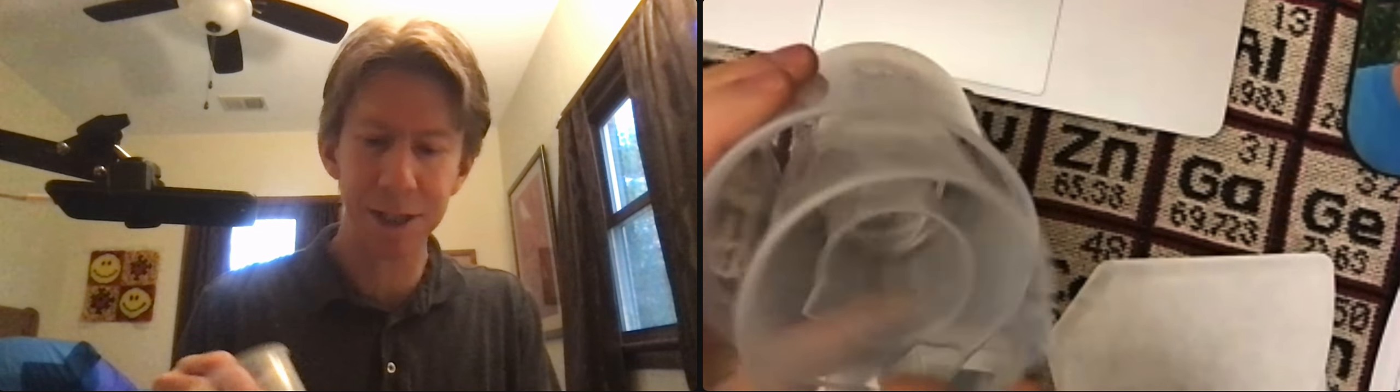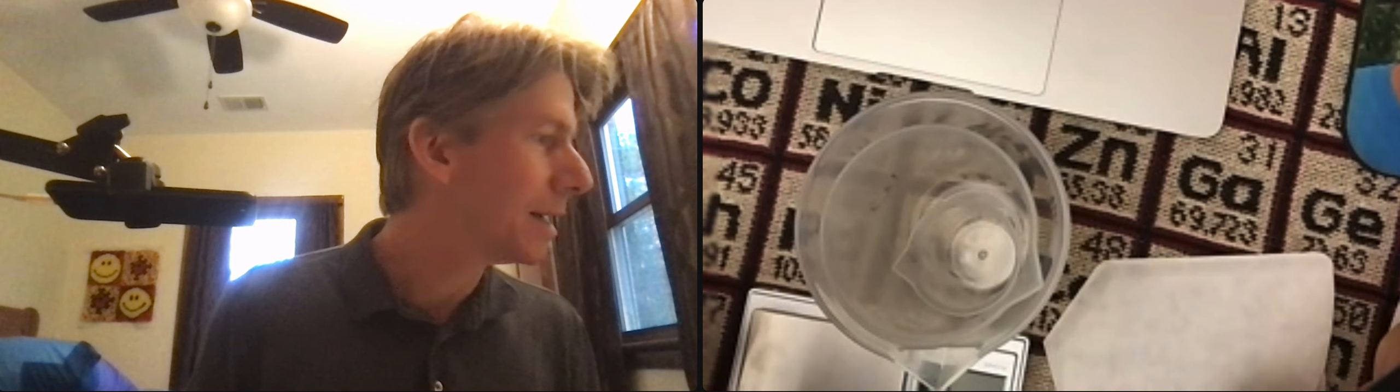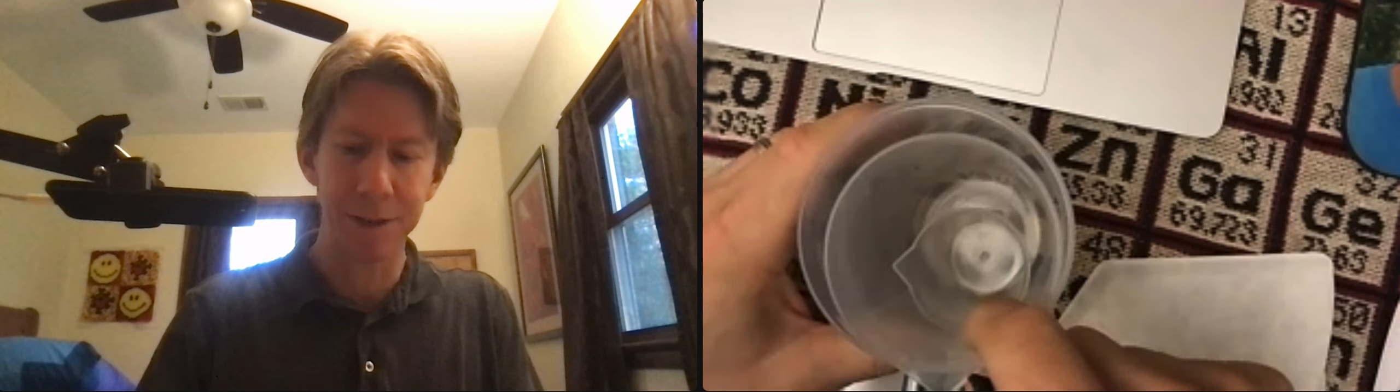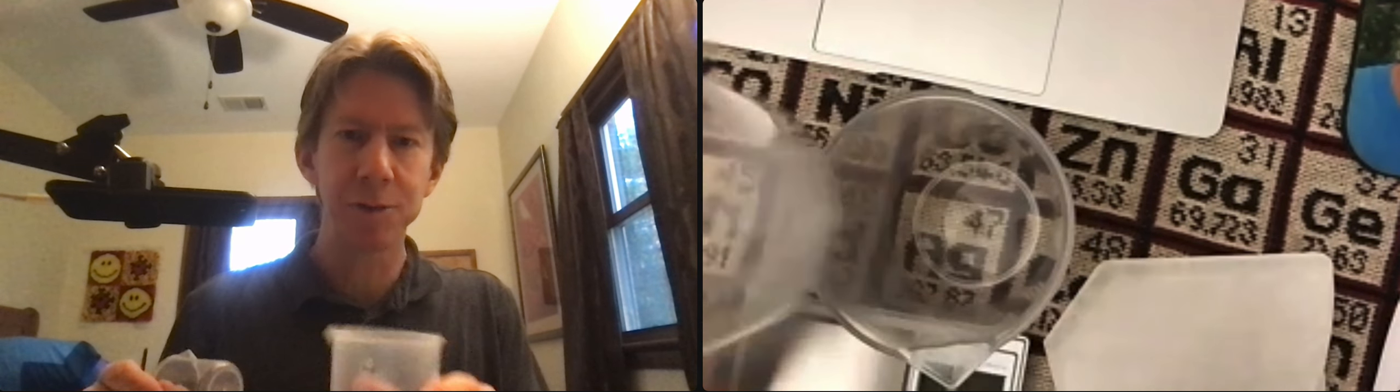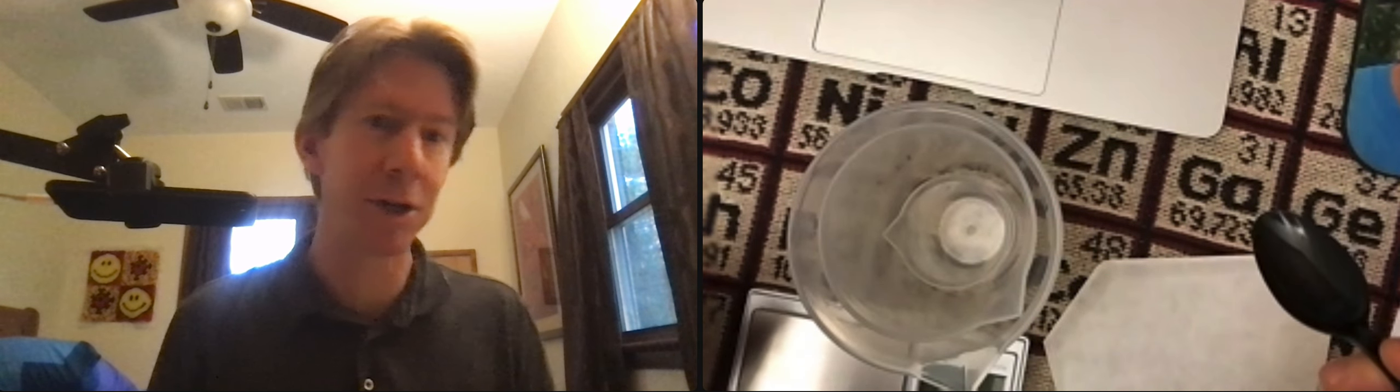The exact sizes don't matter that much, but you do want to use each of the sizes where I say to use each of the sizes, but they're approximate.